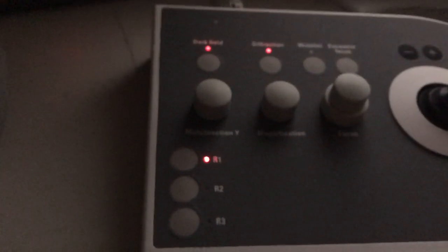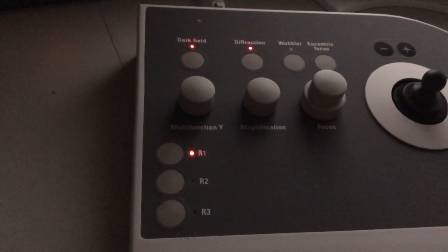So in order to accomplish that, I come over here to the right-hand panel, I hit the dark field button. What that does now is it activates the multifunction knobs on both panels as beam tilts. So you can see now, see if the camera will focus there. And you can see now I'm moving that direct spot from where it was to where the Bragg spot is.